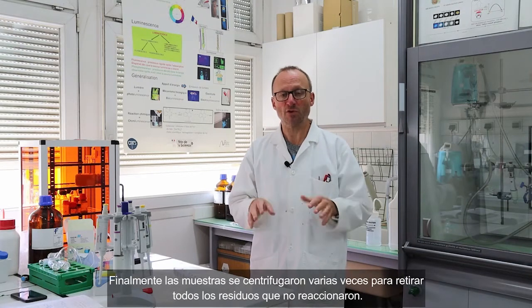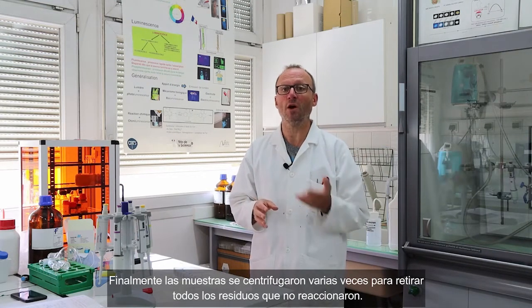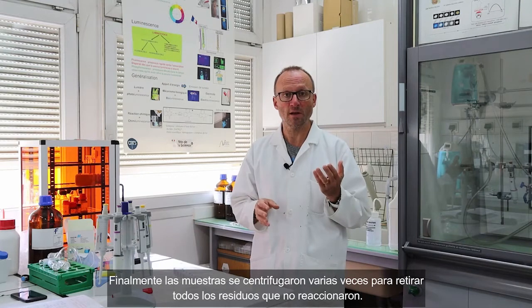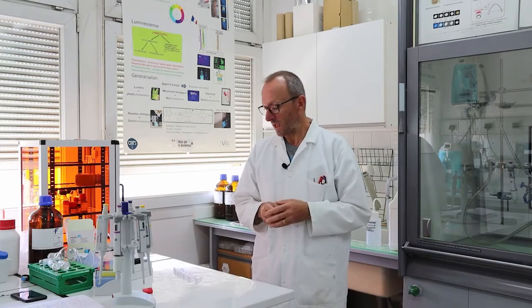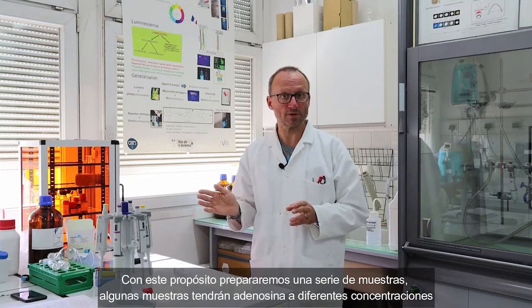Then we added a PEG thiol entity to make sure that we fully saturated the surface of the gold nanoparticles. And then we centrifuged all samples several times to make sure that we were removing all the unreacted reagents. And now samples are ready. We can run the assay. So to do that, we'll prepare a series of samples.